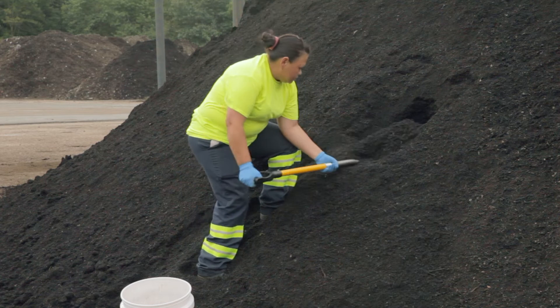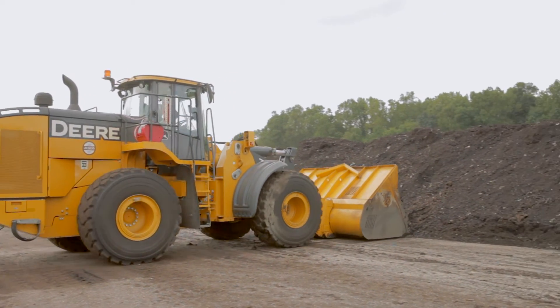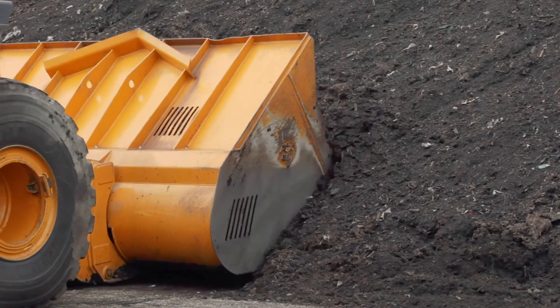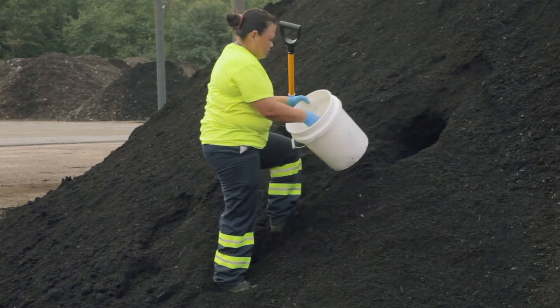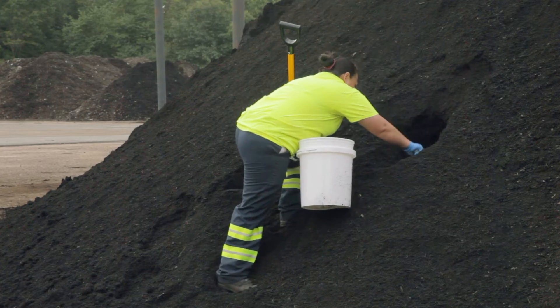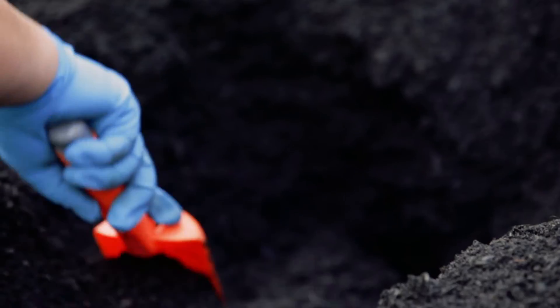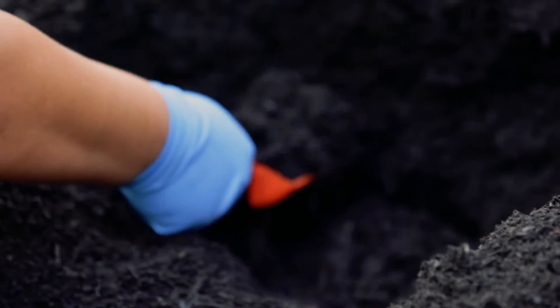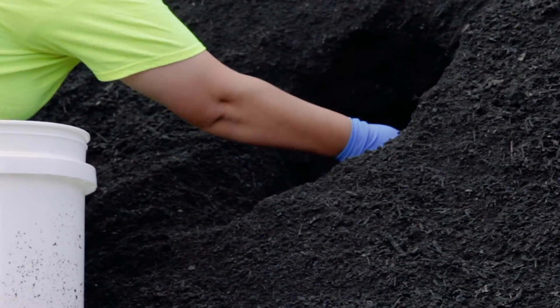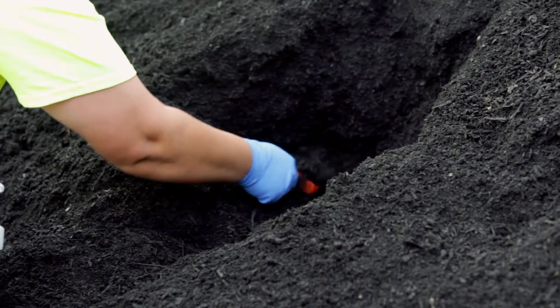Starting with the first random location, use your shovel to dig into the pile to the depth at which you want to collect the sample. For larger facilities and larger stockpiles, using a skid steer or front end loader to cut into the piles can be helpful during subsample collection. Once the desired depth is reached, use the hand trowel to clear away compost that has been in contact with the shovel — this is important to prevent trace metals contamination. Then collect approximately one quart of compost from the desired depth and place this subsample into the five-gallon bucket. Do this at all 15 or more subsample locations.